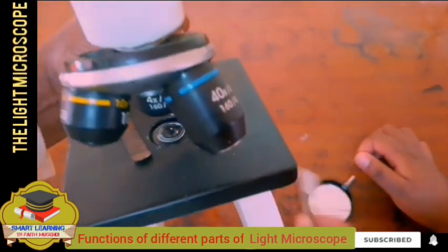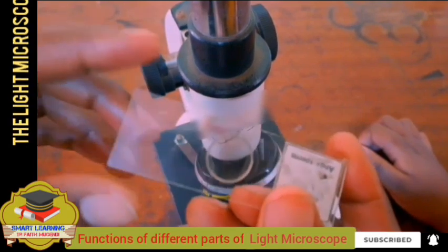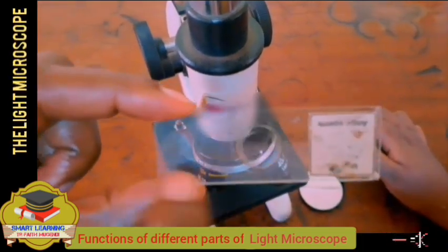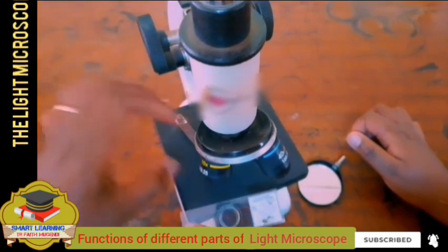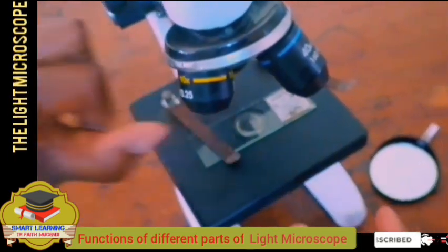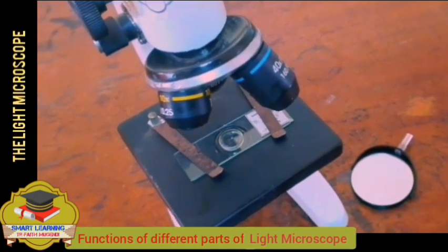When we talk of a microscope slide, we are talking of something like this one. This slide has a permanent cell of a plant. So the slide has got the specimen. That is the slide we are talking about. You put it there and then you clip it so that the slide does not keep moving.